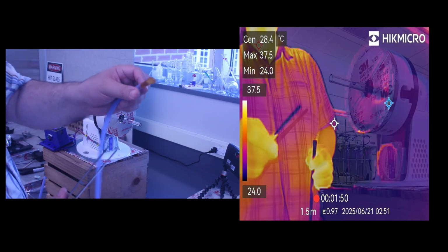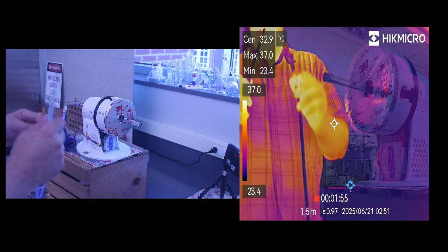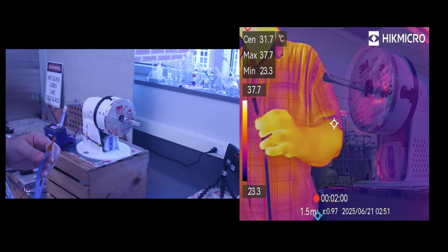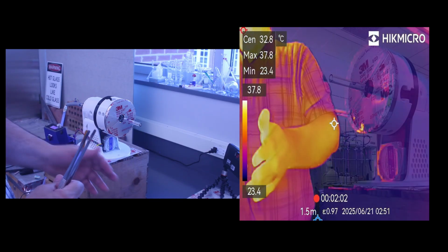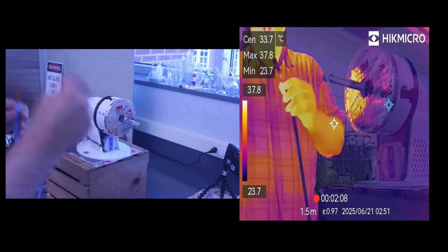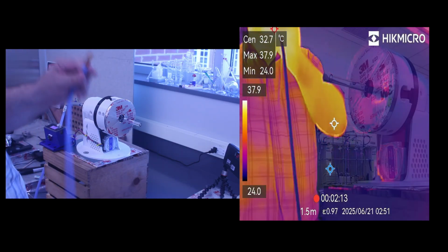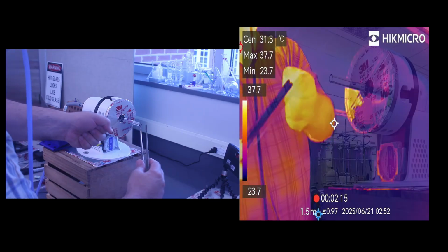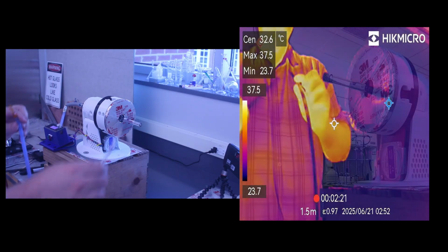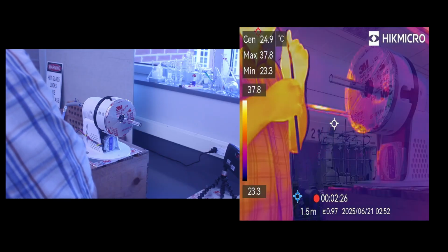Again, as I'm working, I'm going to need to have my blow hose in my mouth. So I'm going to hold it, but I won't be blowing into it. The reason I want to get it in my mouth before I even light the torch is because once I have the torch in my hand, I can't just set that down to grab my blow hose. So again, think about what you need to do before you light the torch. I'm going to have my blow hose, I'm going to have my torch in my hand, I'm going to remove this, and then at this stage, as I'm heating, I'm going to need to blow. So to make it easier on myself, I want to have all my equipment ready to go.